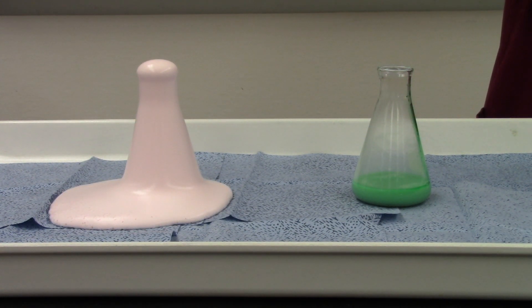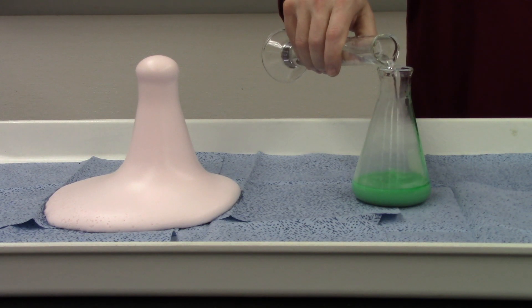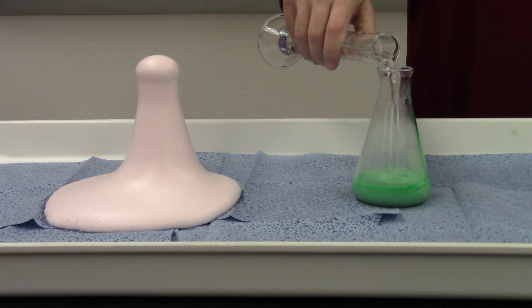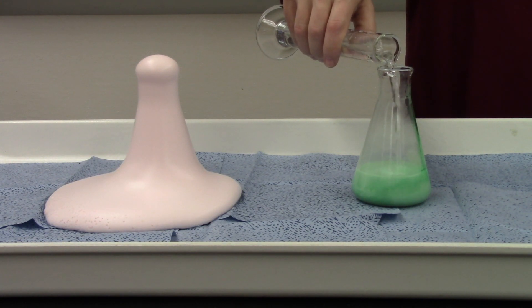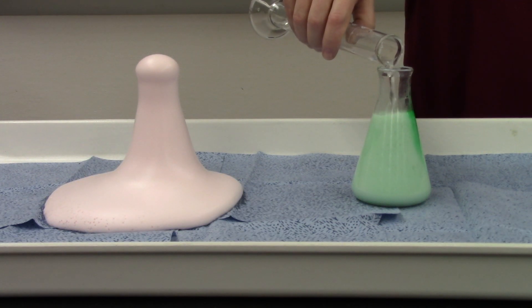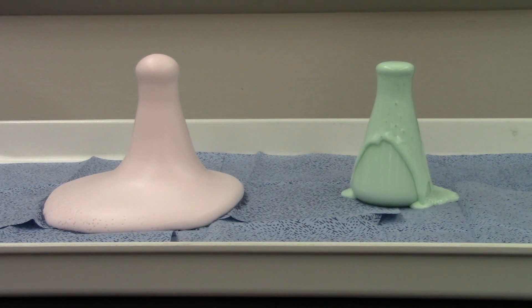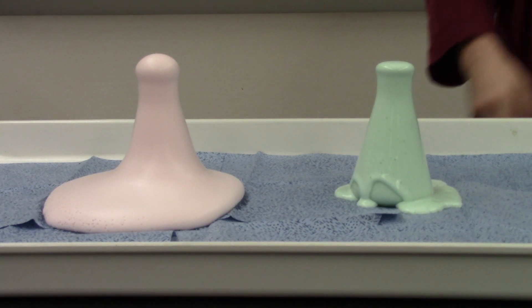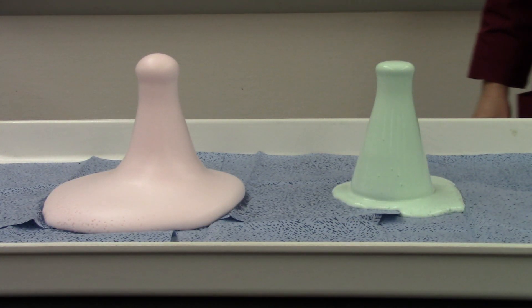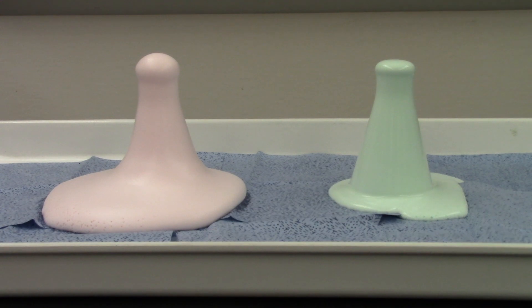Here's six percent hydrogen peroxide. Look at that — that's really cool. I love this reaction, love how it spills over with soap suds like that.